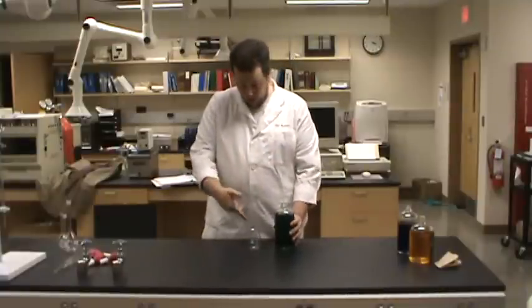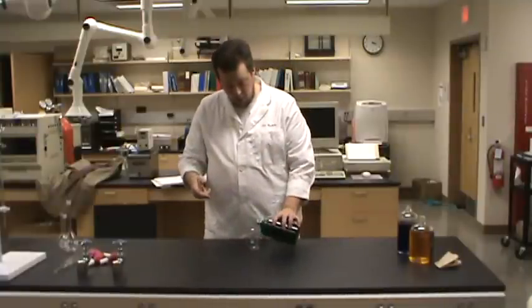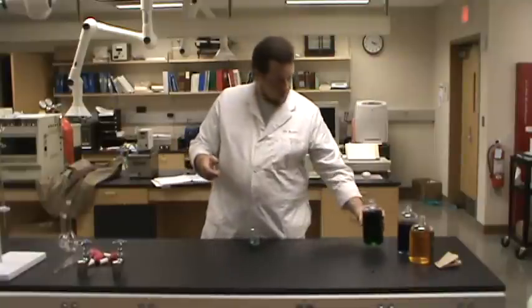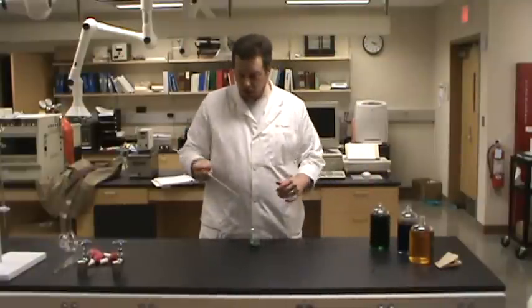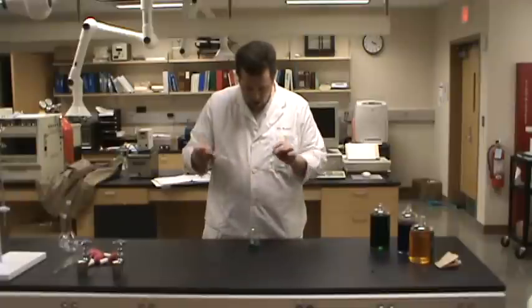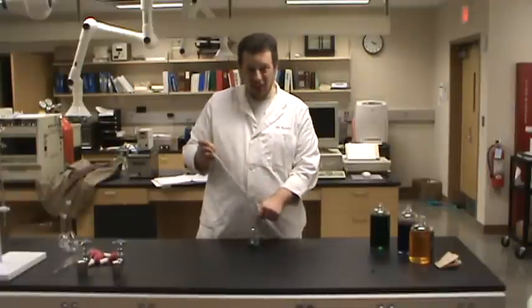So I've got my 150 milliliter beaker, let me pour some of this liquid green reagent in. And now, how do I get the liquid from there to there?